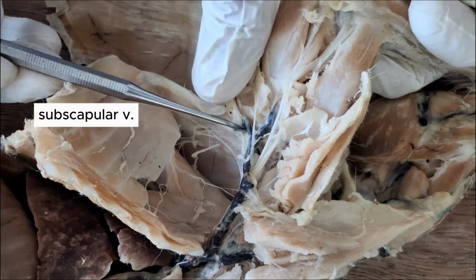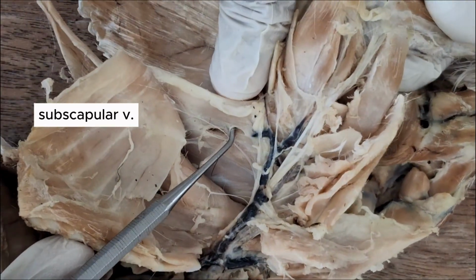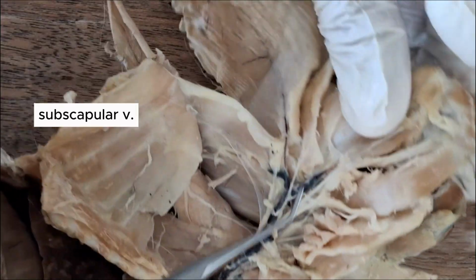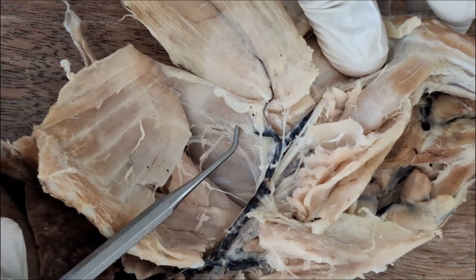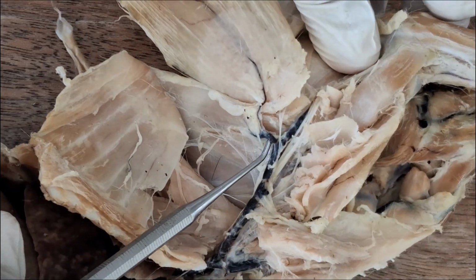It's that vein that goes straight for the teres major. So this is the teres major. If you've seen a short, thick vein that goes to the teres major, going for it, that's a subscapular vein.